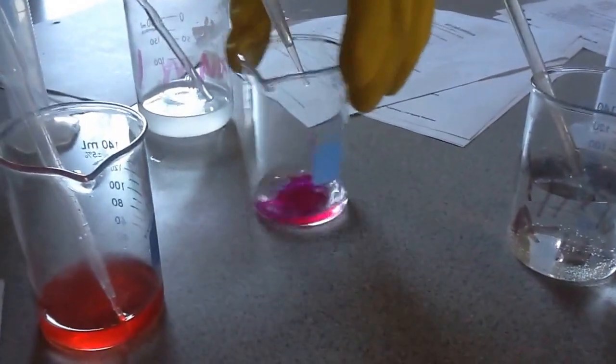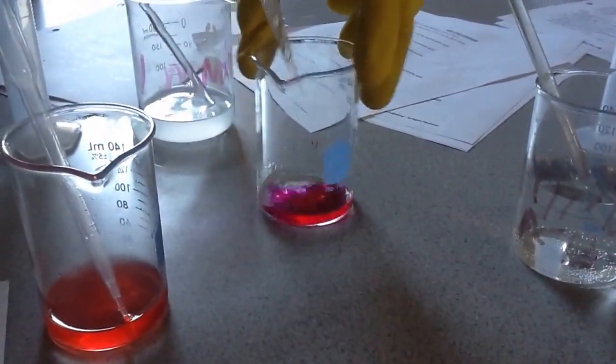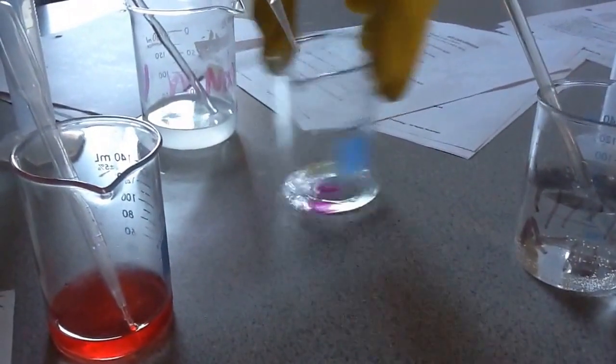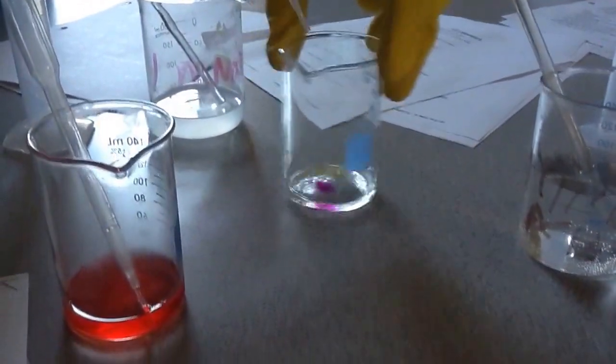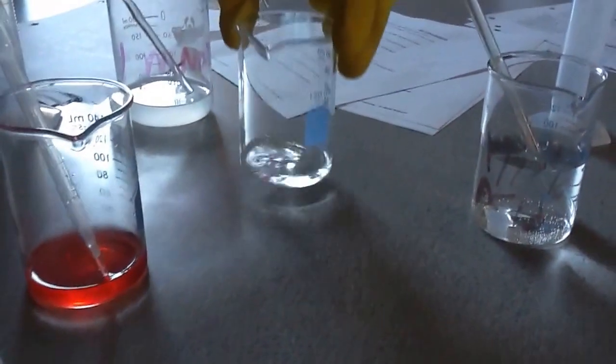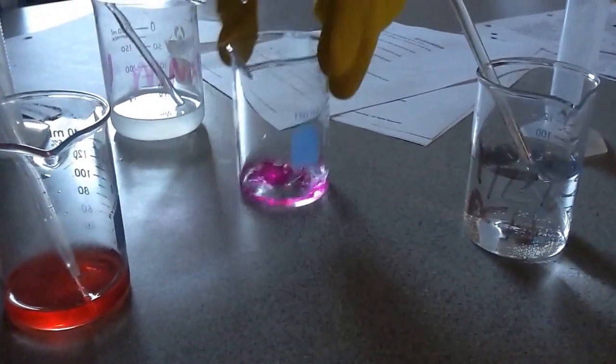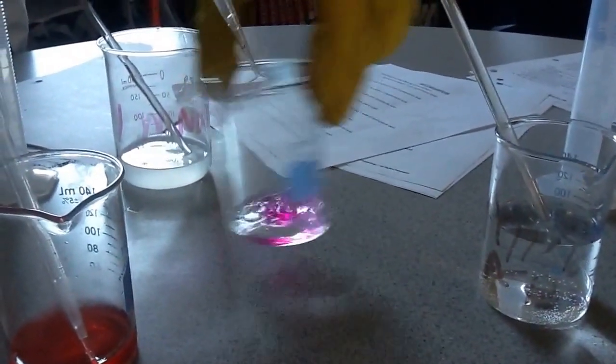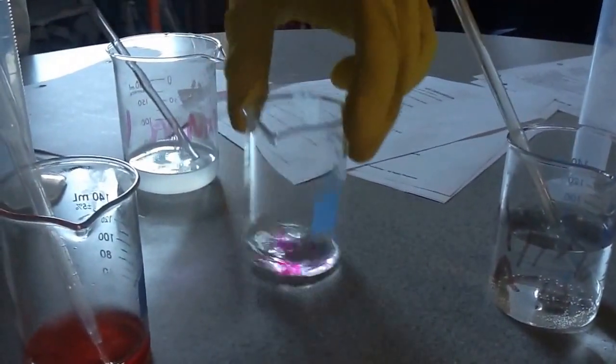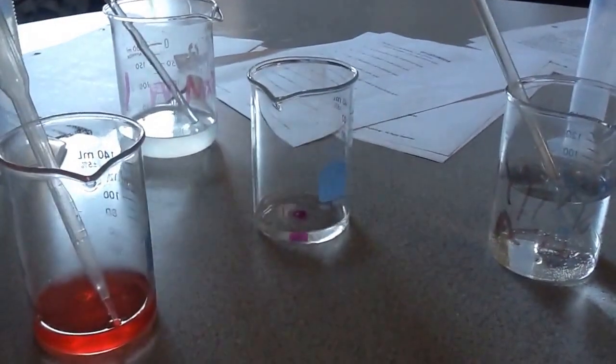This is the same experiment that we saw yesterday, right? As I add more and more base to it, it neutralizes it. Citric acid and vinegar, if it's the same molarity, it's actually the exact same calculations. You just figure out the amount of volume used until it stays pinkish purple.